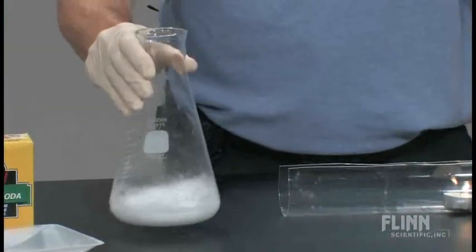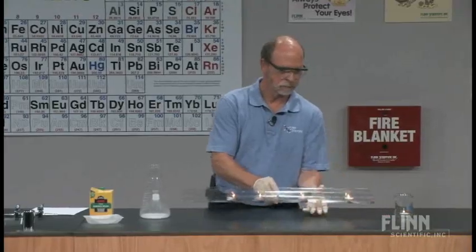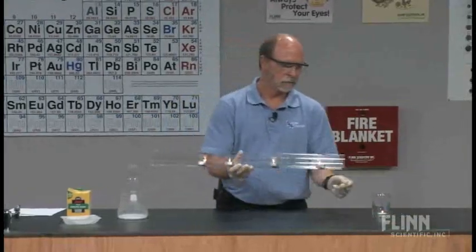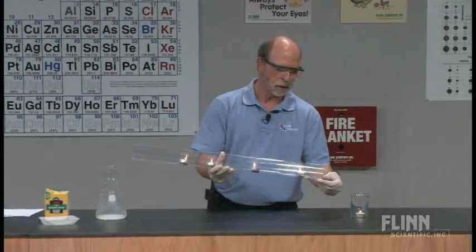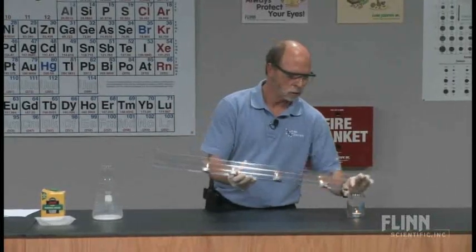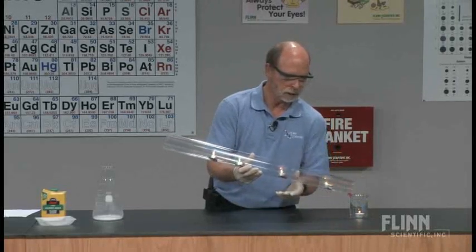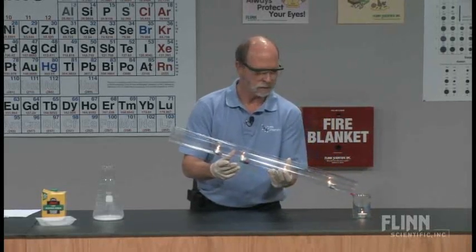Of course, because I can't see that, I won't know. Now, I've put a little bit of clay on the bottom of the tube to try to hold that tube in place at the edge of the beaker. If I may have the lights down now.